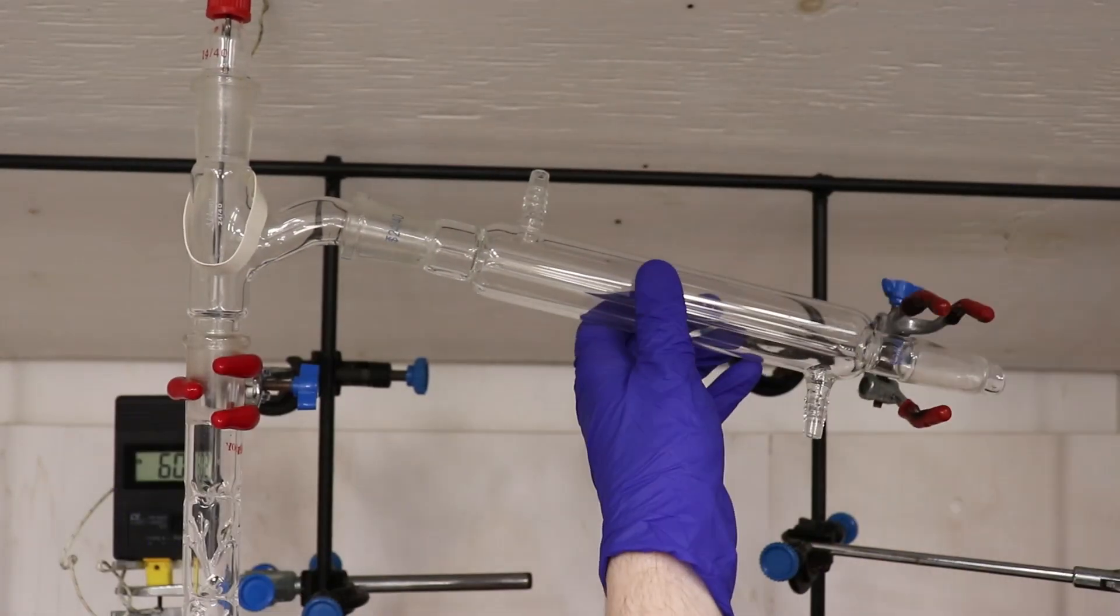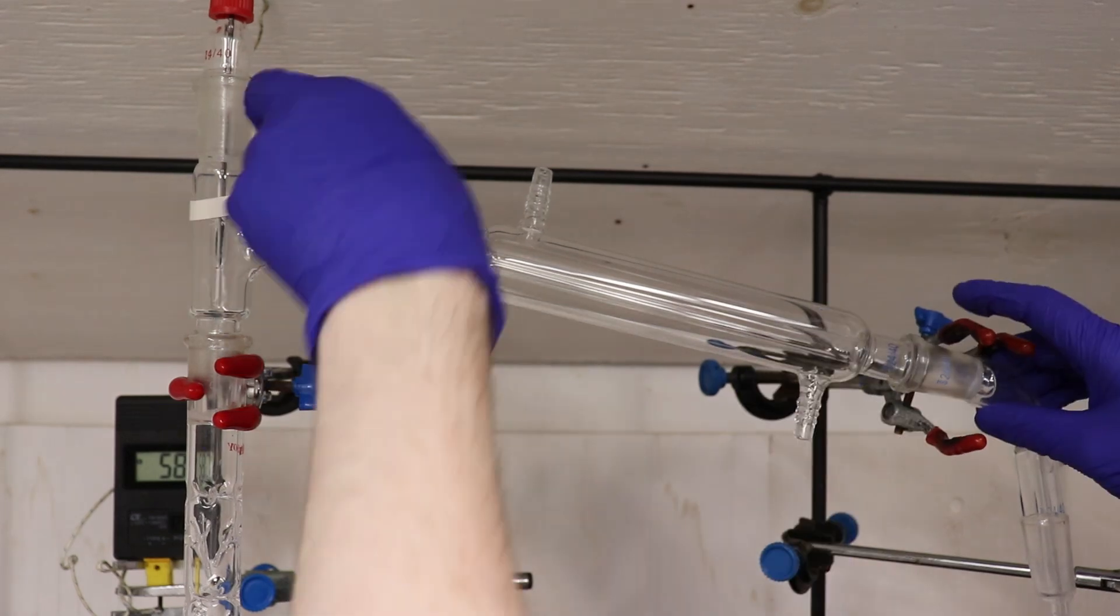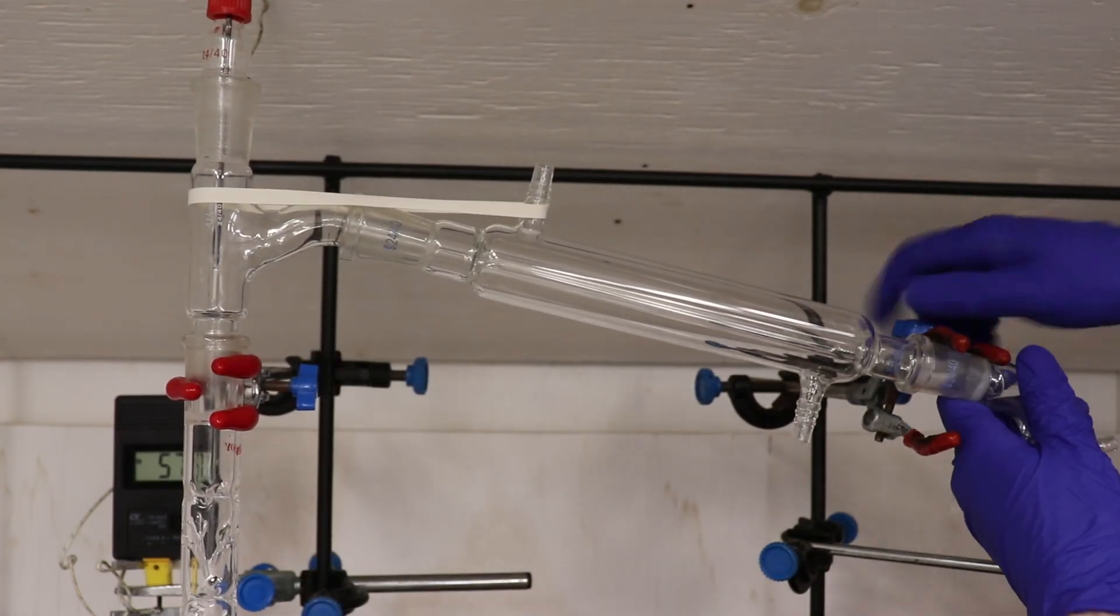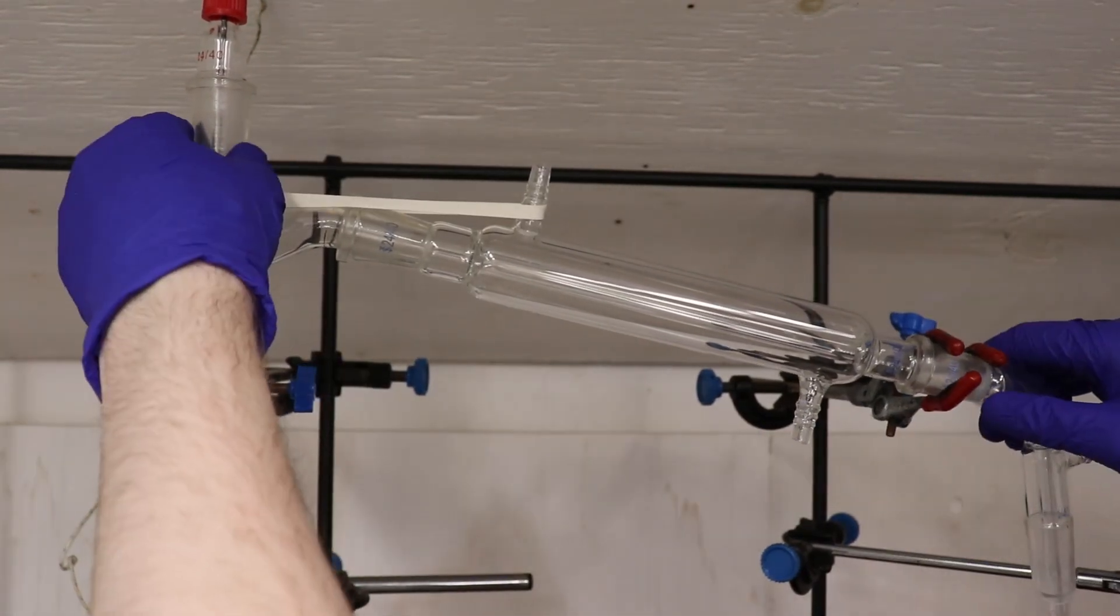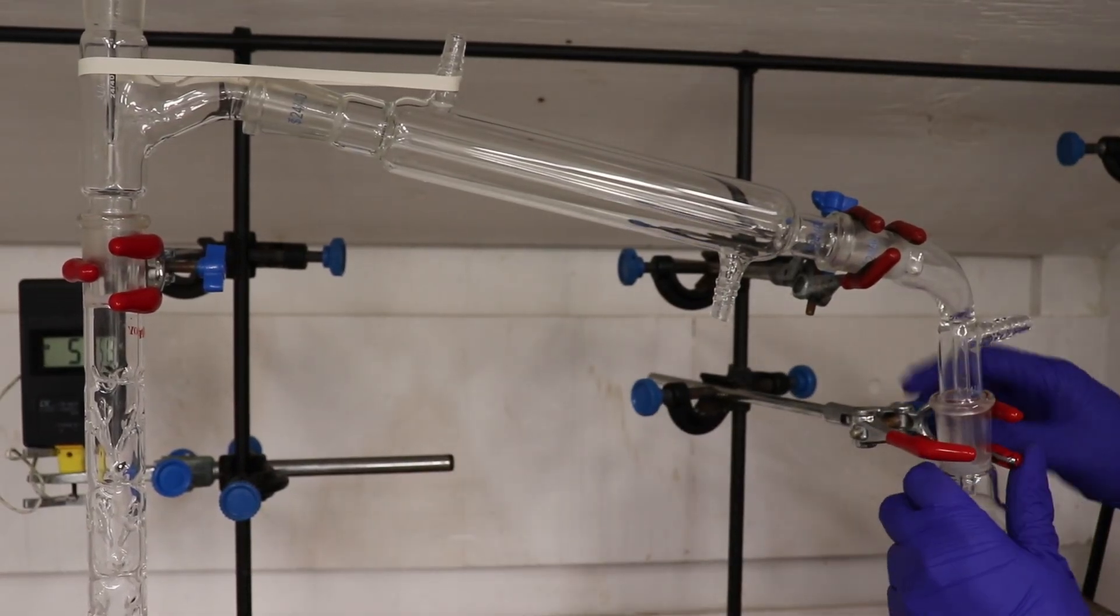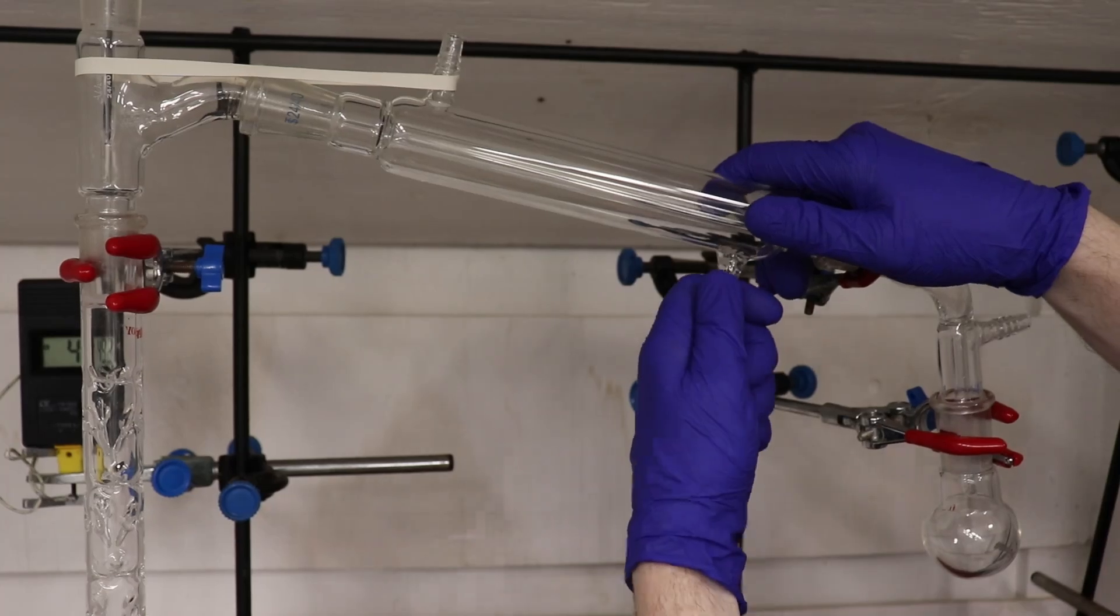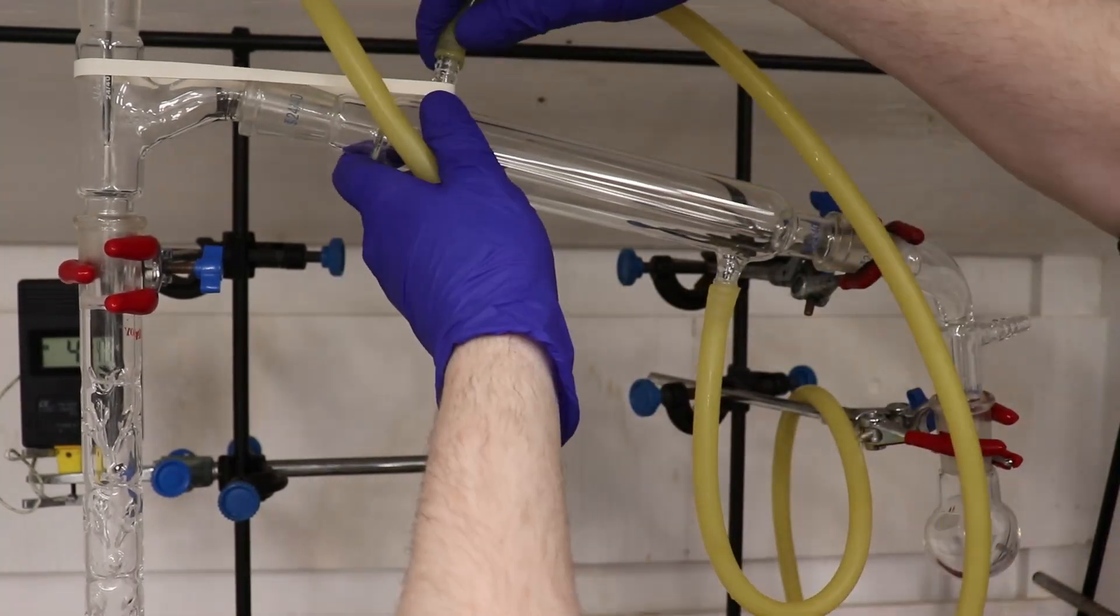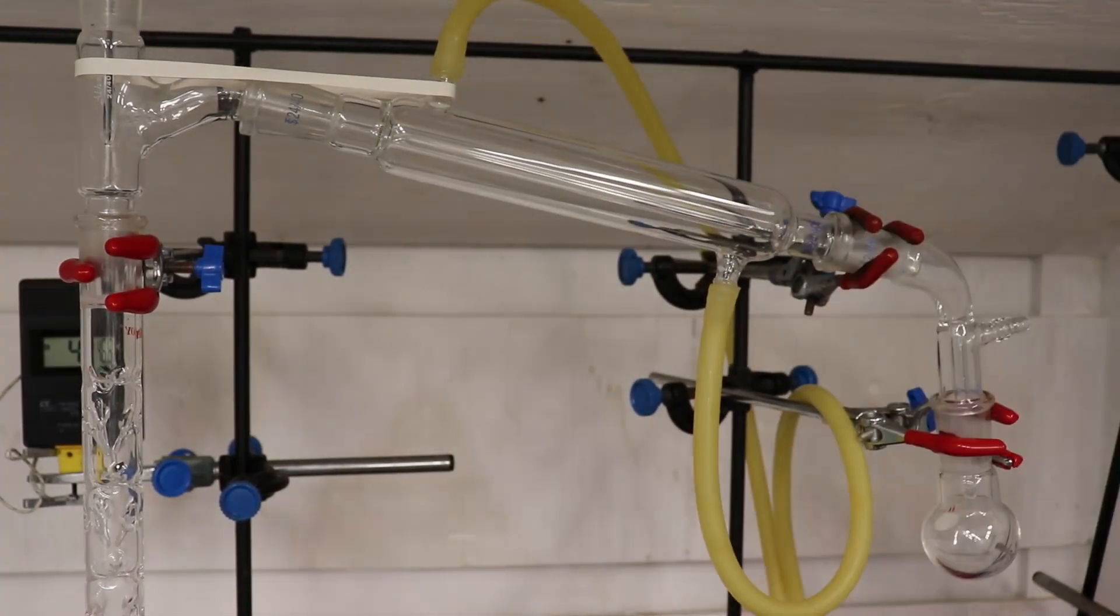My reason for doing this, was so that I could replace the condenser and receiving adapter with clean glassware. This was to ensure the elimination of any chloroform or ethanol from the product fraction, since we're going to be using this material in an organometallic coupling, and any protic impurities will result in the organometallic reagent being destroyed.